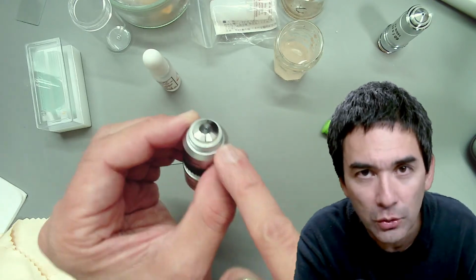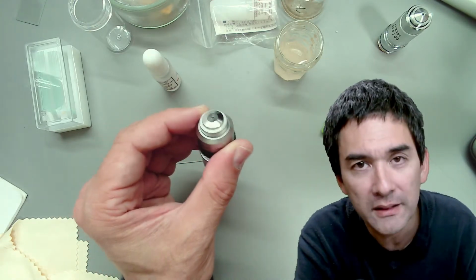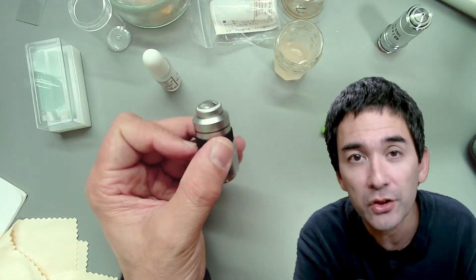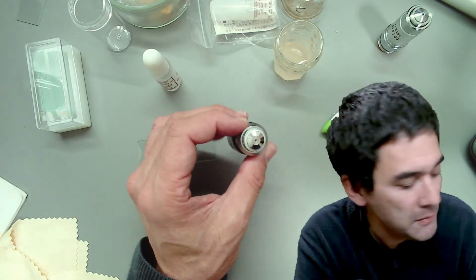And generally you go with what the manufacturer recommends, or one of the things that has also been recommended is a 70% ether and 30% alcohol mixture. It's very volatile. And then, I mean, maybe I should make a cleaning video.